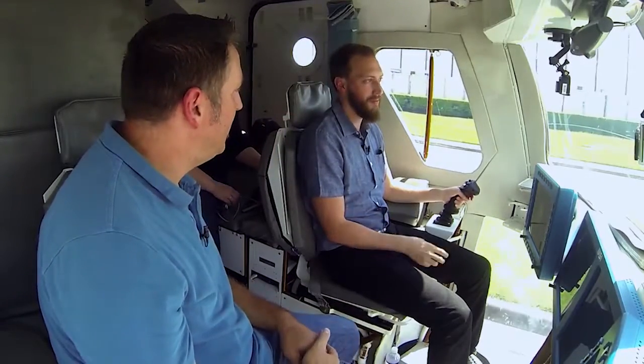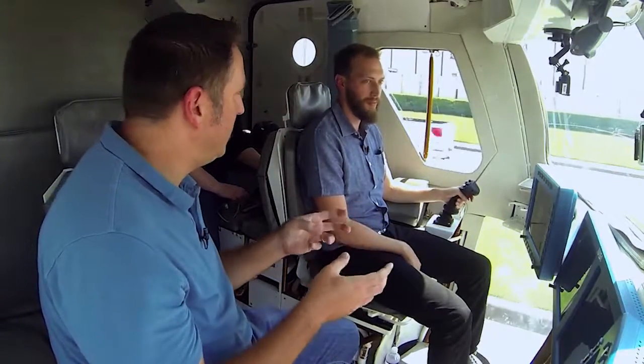So let's say I'm on a space station or I'm on the surface of Mars, I scoop up a sample, I put it in there, and that thing can actually tell me what it is? That's the idea. There's a few more steps in there. So you have to extract cells from the dirt, then you have to get the DNA out of the cells, and then do a little bit of library preparation. But there's a number of teams and people that are working on ways to have either robots do that or to make it really easy for humans to do it.